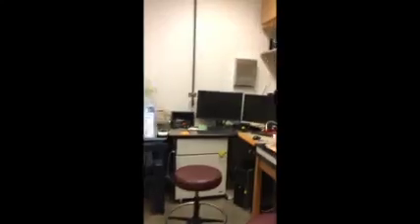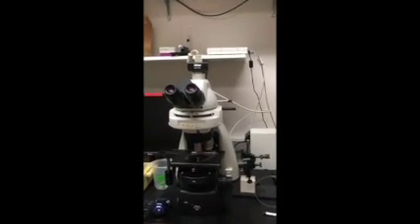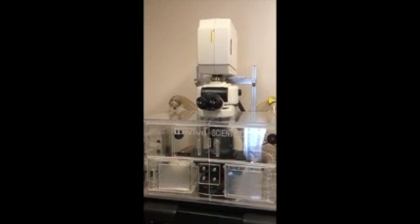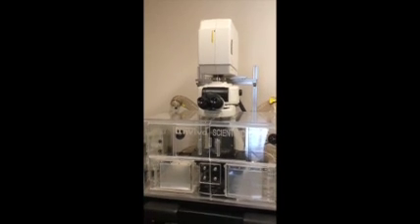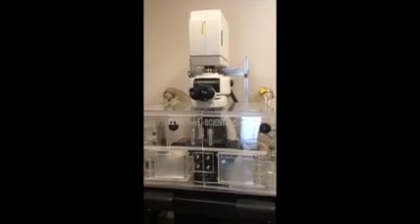It's the microscope room. And in here we have a fluorescent dissecting microscope, a fluorescent compound scope, and one of the most important pieces of equipment that we use to study zebrafish development in real time is this laser scanning confocal microscope outfitted with a temperature-controlled box around it so that the zebrafish can develop normally and we can film that process.